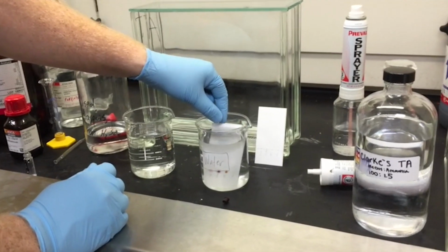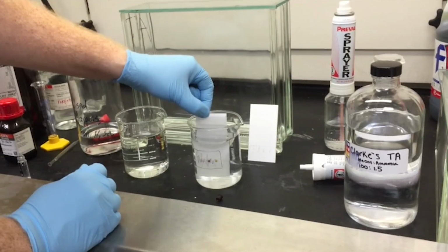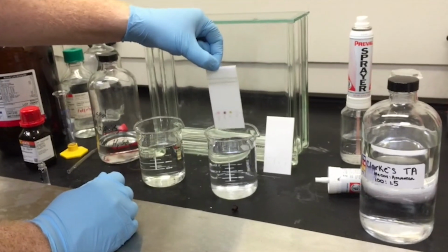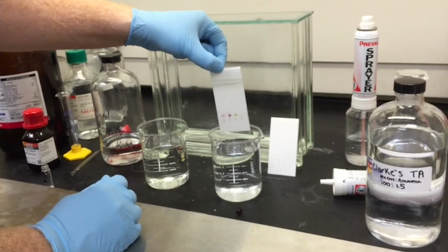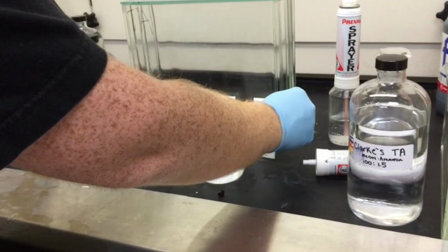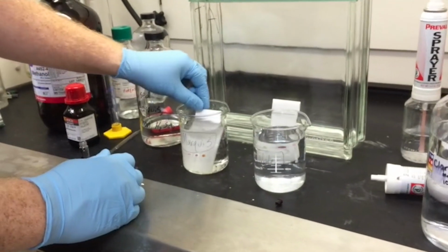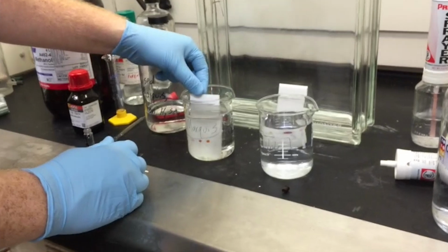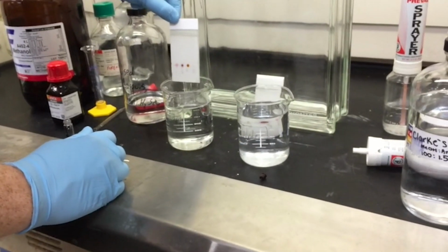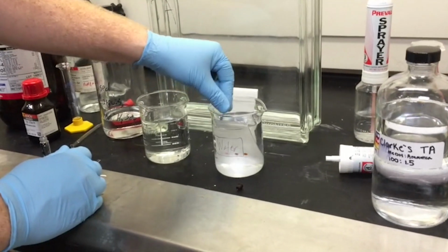Note that because the Marquis is so dangerous, I'm soaking in a little bit of water before removing it. Again, I definitely should be wearing a lab coat here, and I'm absolutely working in the hood. If you want to do something like this with a color test, that's fine. I'll try to get you the ingredients to make the color test. But check with me before you start making bunches of this stuff. Or actually, you won't make the Marquis. If you want the Marquis, I will make it for you. But before you start trying to use this stuff, check with me. We'll talk about it. And if it's appropriate, then we will get you set up to do that.